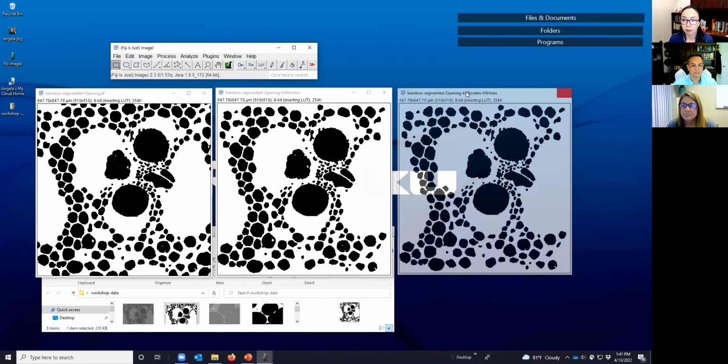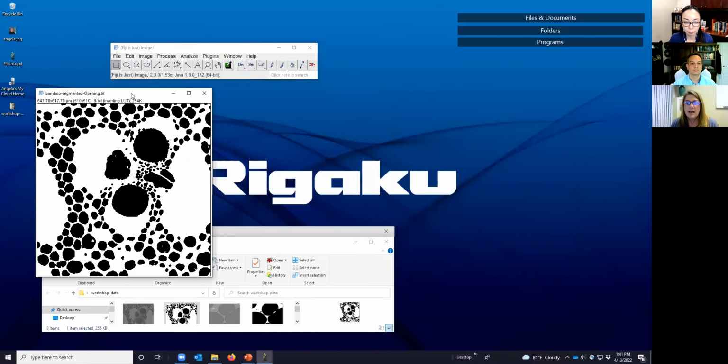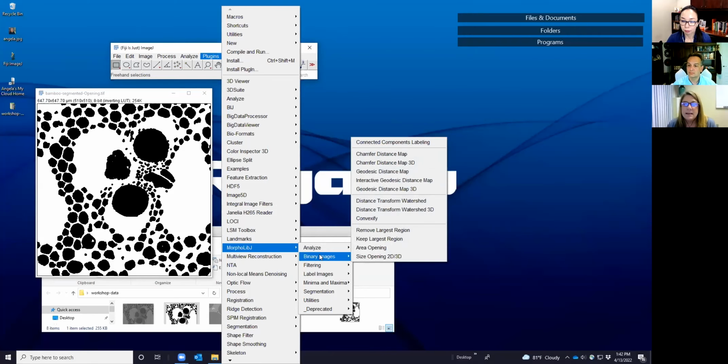All right. So what we're going to do now is we're going to move on, and we're going to look at our watershed operation. So I showed you in the presentation how to do the distance transform, and then we did the watershed. Well, it turns out that MorphoLibJ will let you do each of these steps independently, or you can do them all at once. So for example, in plugins, MorphoLibJ, we can calculate an operation on a binary image.